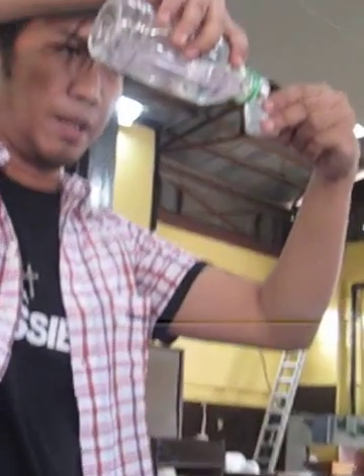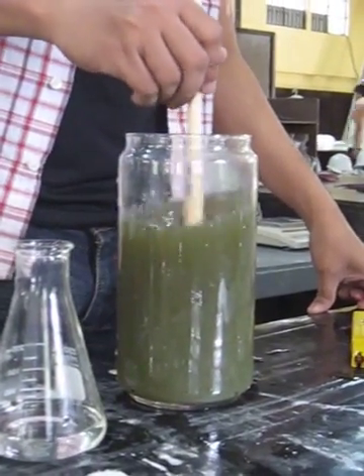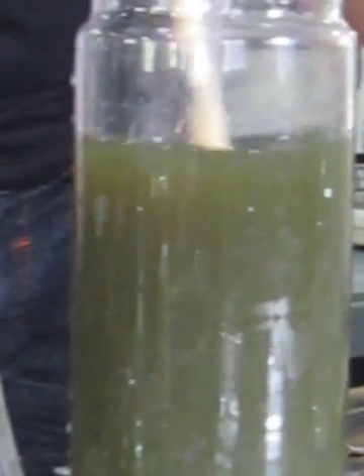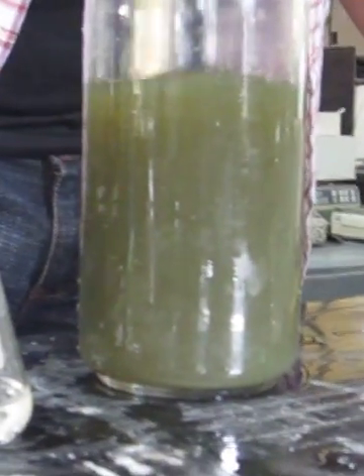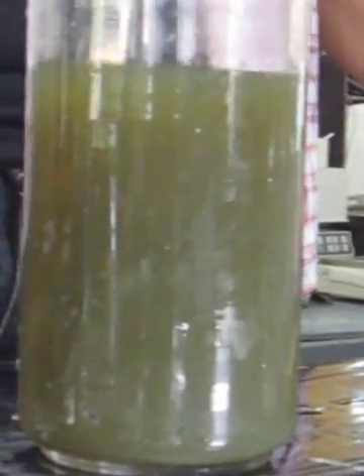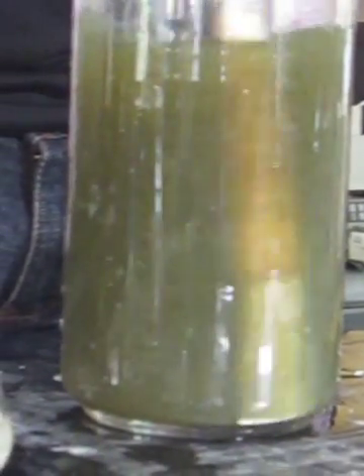Just add 10 ml of polymer. We're going to slowly stir the solution. As you can see, the precipitates form, and later you're going to see a separation of the copper and the clear treated water.